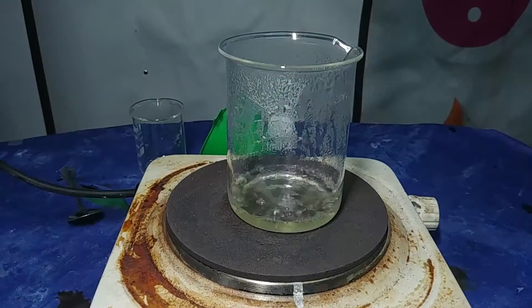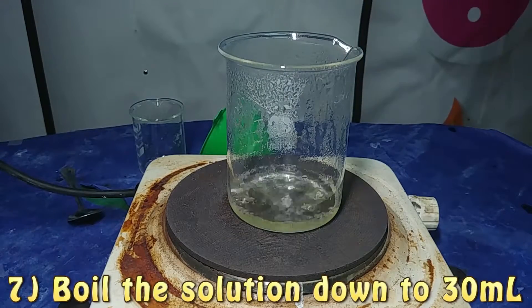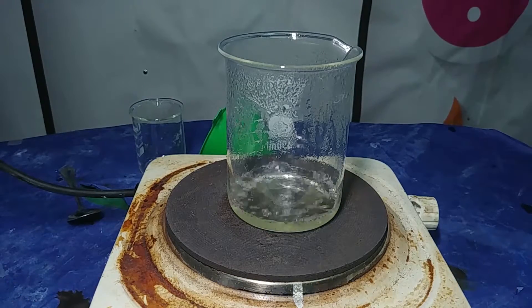So because of this we just have to boil all the water off and we get our precipitate, which is our final product. That is easy to dry, and we have finished our experiment.